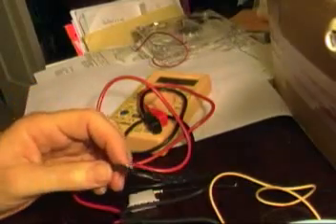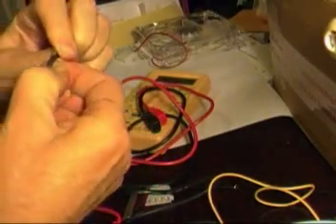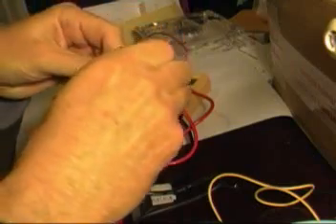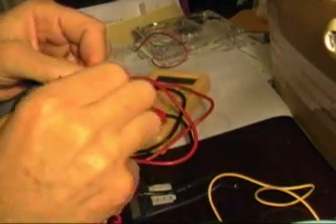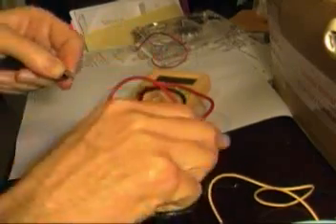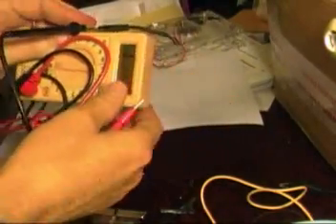I've disconnected the power supply from the wall and I'm cutting off the end of the connector that came with the power supply. Using a razor blade, I'm going to remove some of the insulation — the outermost black insulation from the wires — and I'm going to strip these wires. Just with my thumbnail, actually, the insulation was soft enough where I could just get my thumbnail into it and drag it across. If you use a knife or something, sometimes it can cut through the wire.